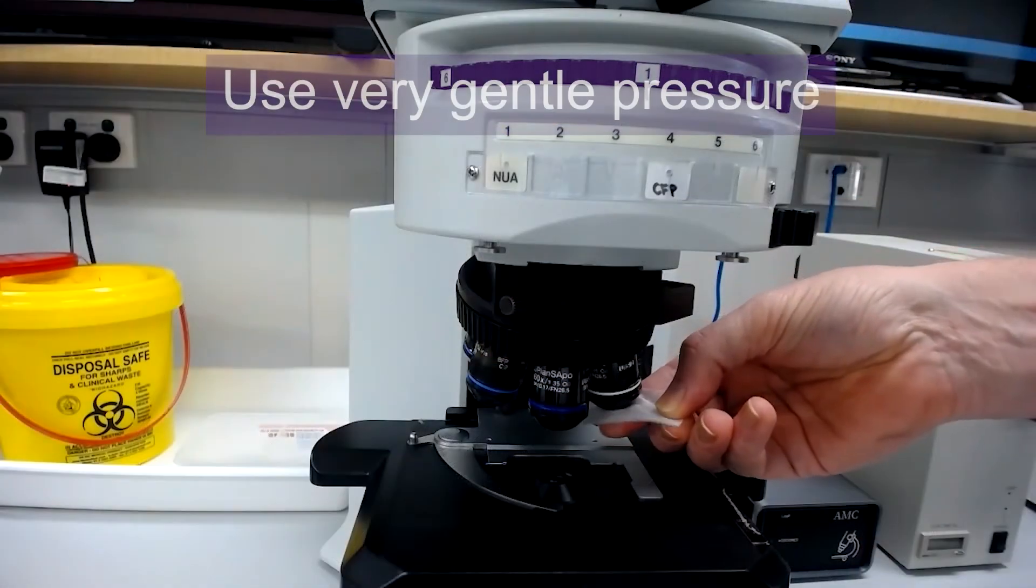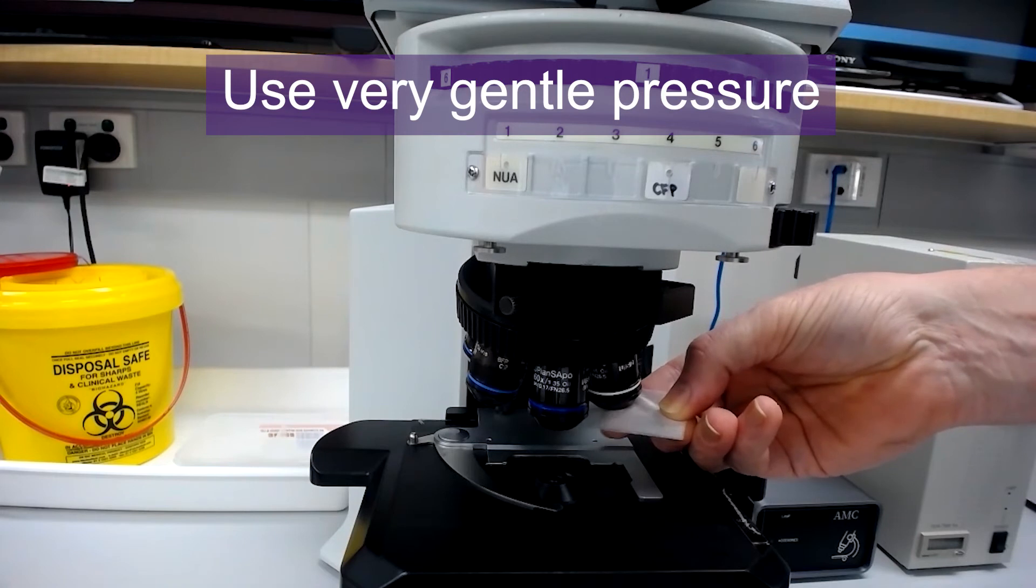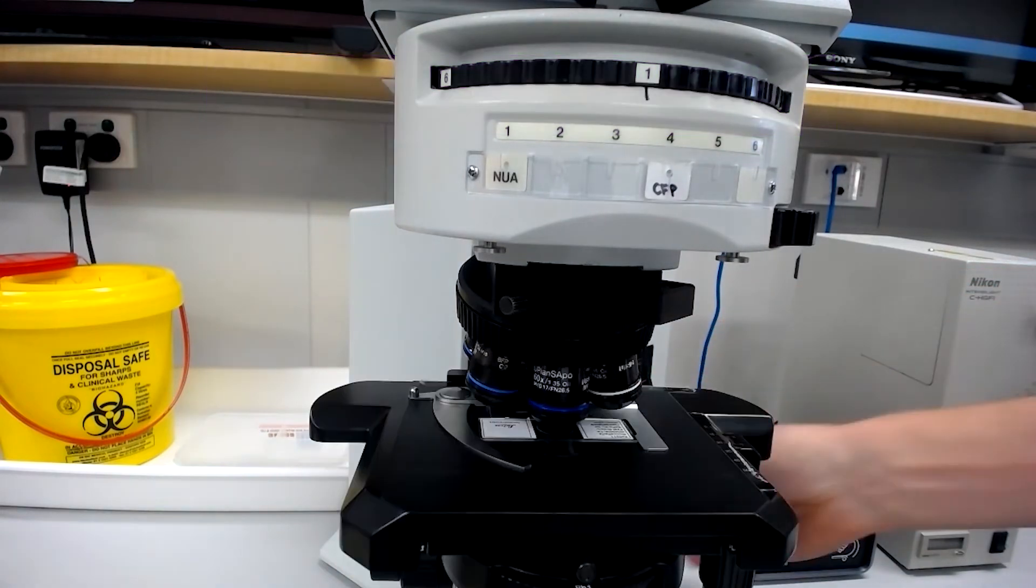Oil objectives are often spring-loaded, so don't be alarmed if the nose of the objective moves.